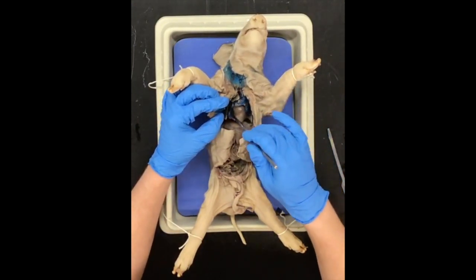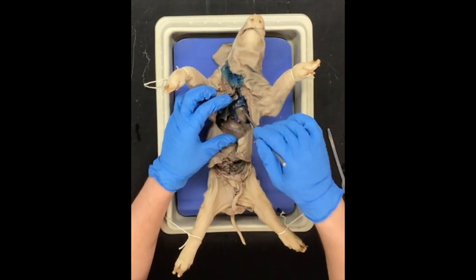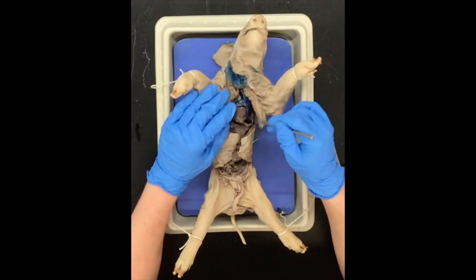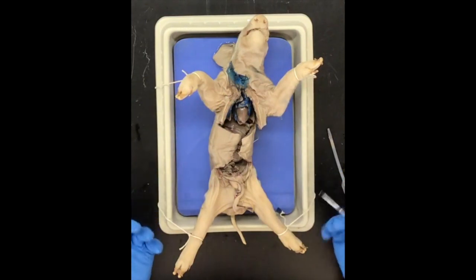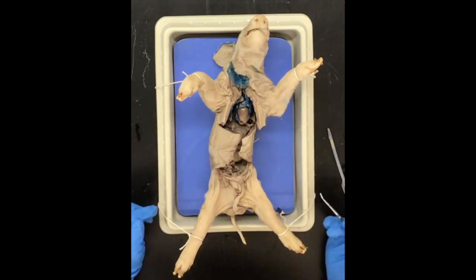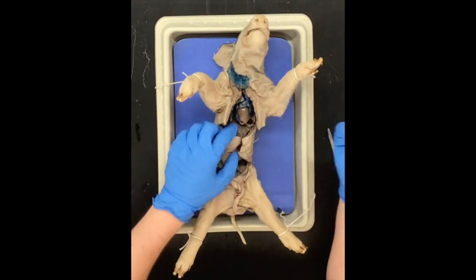Around the heart especially, you can see some of these lungs — the different lobes of the lung. The lungs allow us to breathe. You can see lobes on both sides surrounding the heart. The heart is right in the center of the chest and serves as the primary pump to get all the blood to the rest of the body — to carry nutrients and deliver wastes to where they need to go, like the kidneys, to get the wastes out of our body and into our urine. The same goes for the pig.